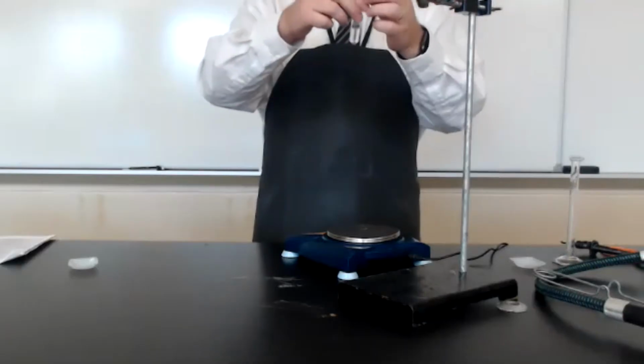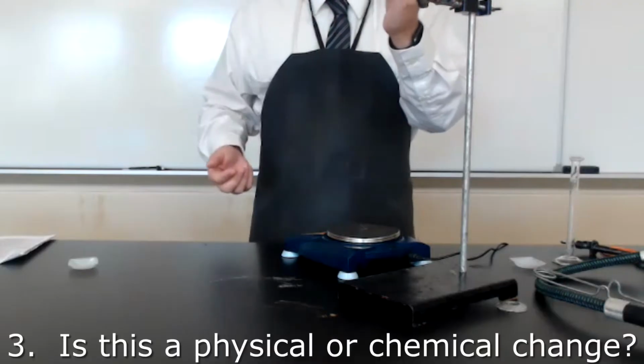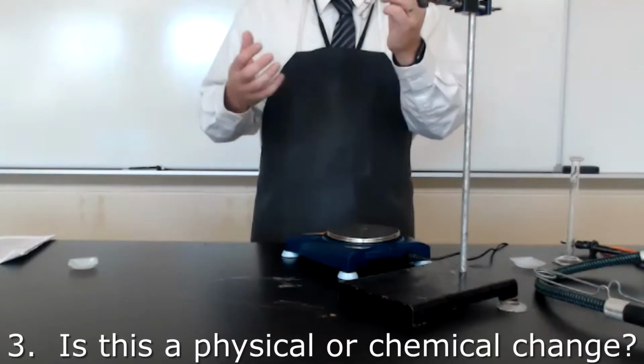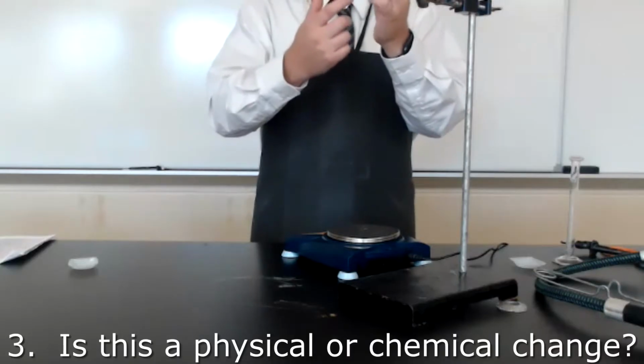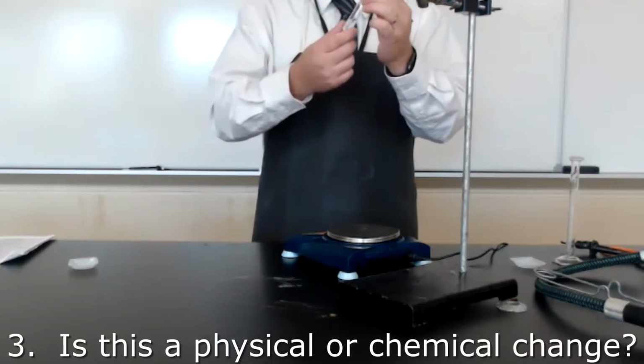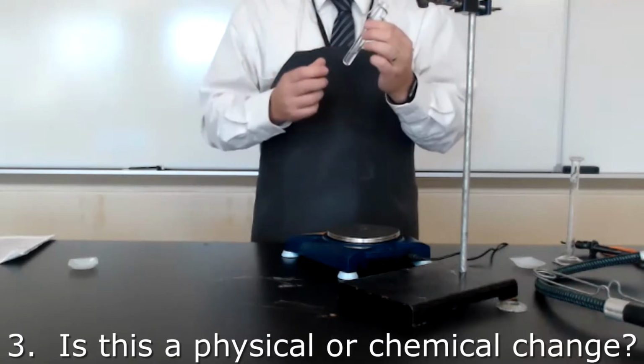At this point, the sodium chloride we added has been dissolved. The solution appears just like it did before, because all of our ionic solid has now dissociated into sodium ions and chloride ions that are floating around in the solution. Is this a physical or a chemical change?